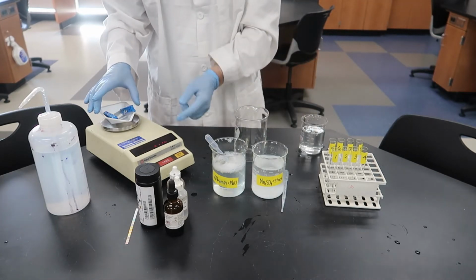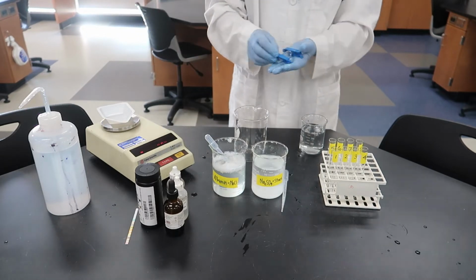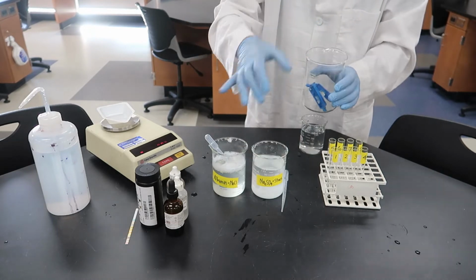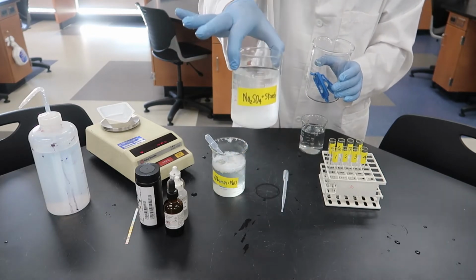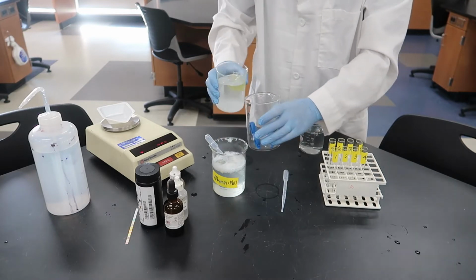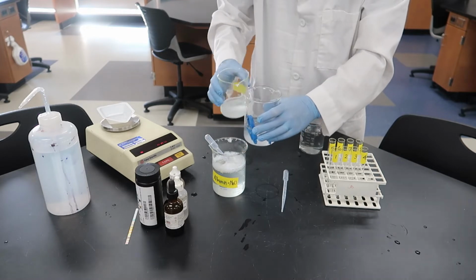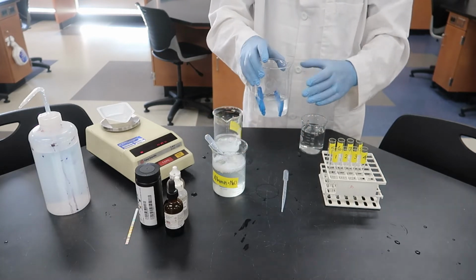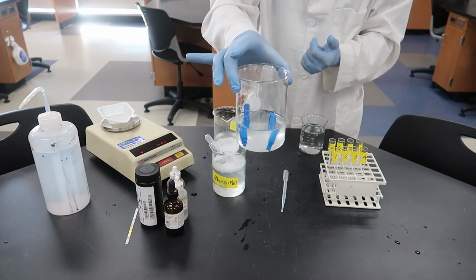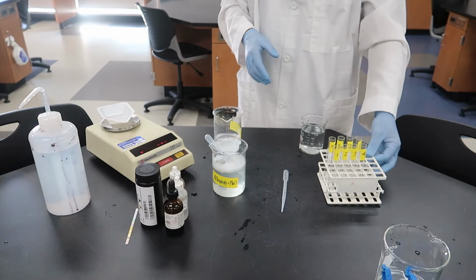Okay, and now we're ready to put our dialysis tubing bag into the beaker, and we'll cover it up with the sodium sulfate and starch solution and let it sit for a while, so that we'll see if the materials that can diffuse, and water, if water does as well, will diffuse through the bag. And there we go. We've got our dialysis tubing inside our beaker, and the solutions are separated by the membrane.